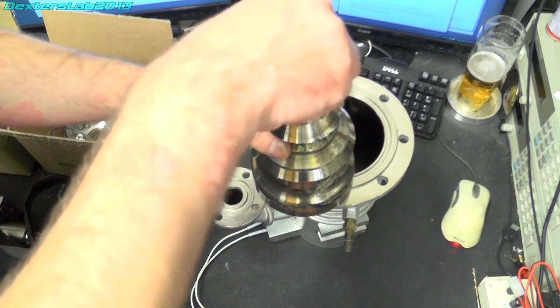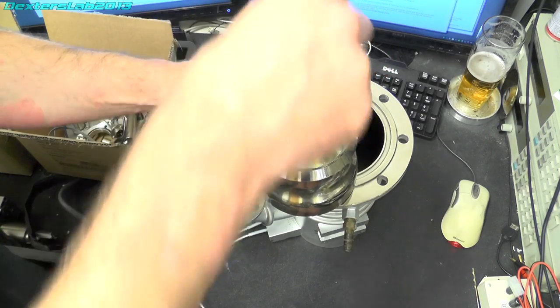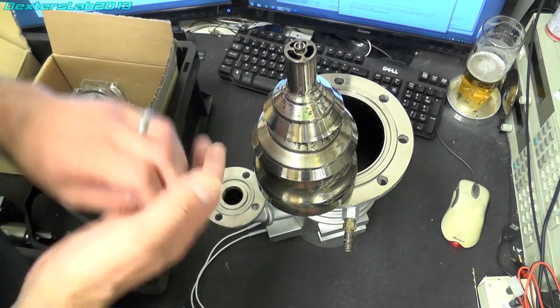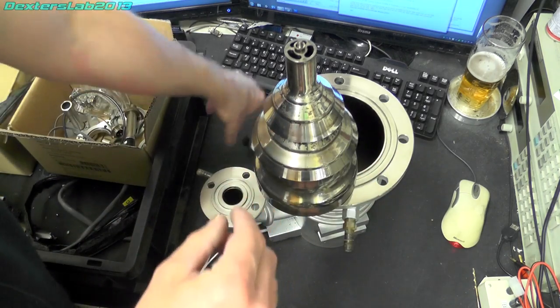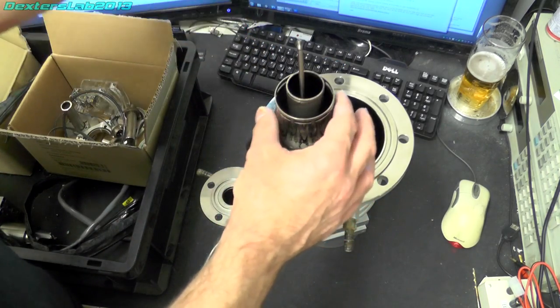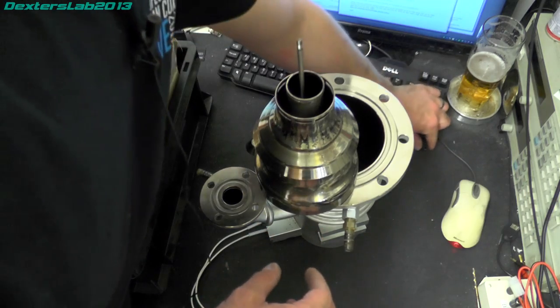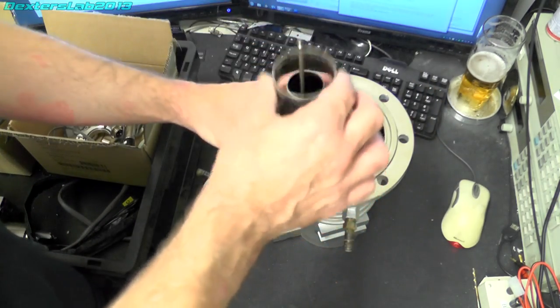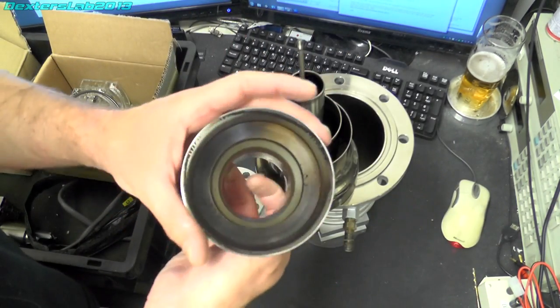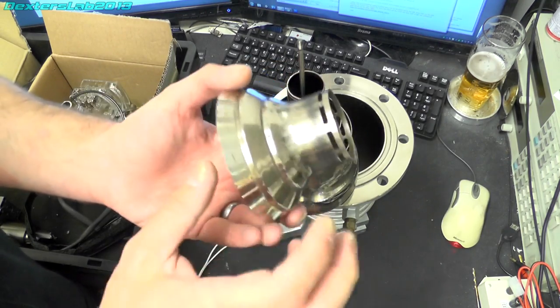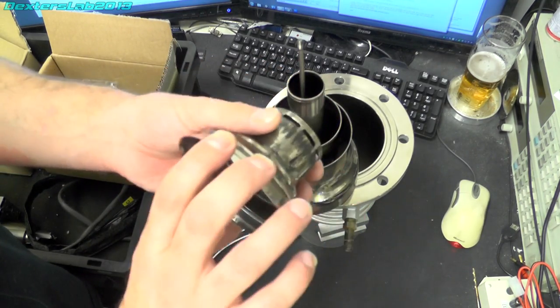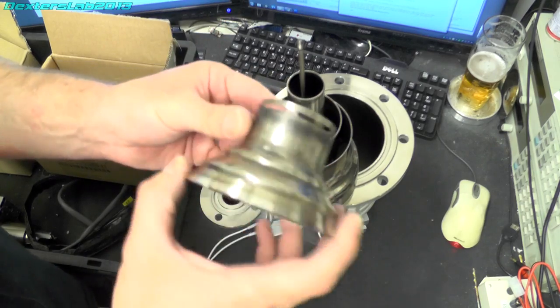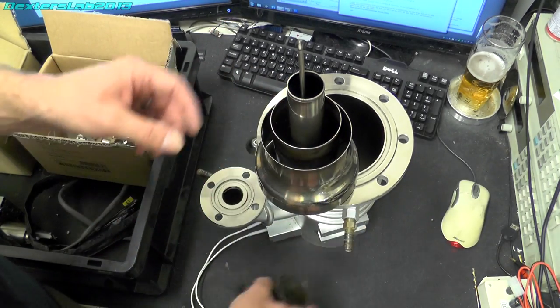So the Christmas tree just disassembles pretty easily, just unscrews. So we've just got a metal top. And then each of the separate bits, oh I'm losing bits everywhere, come apart to allow you to clean them. Obviously you can see I have made a start on this and it was in pretty bad condition when I started. Still a bit of work to do though.